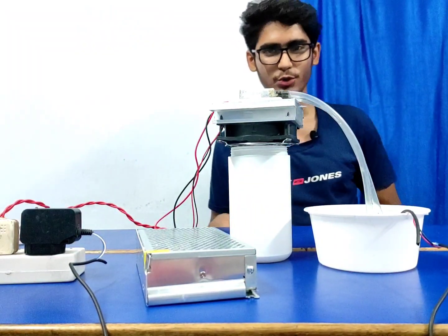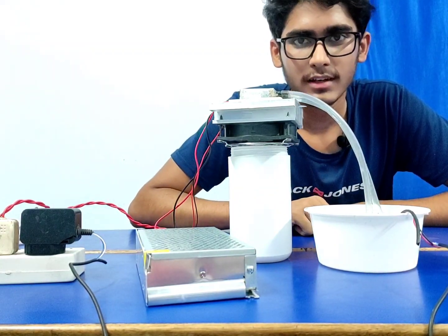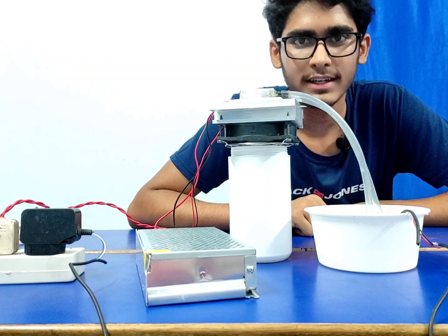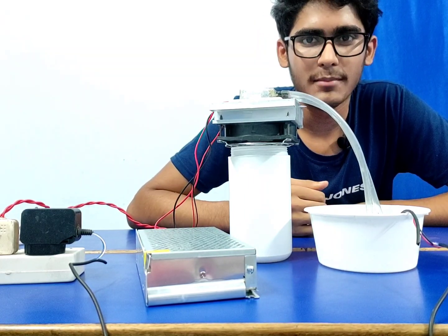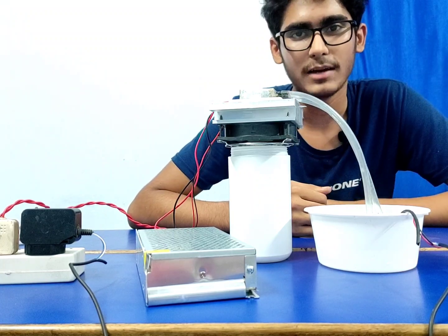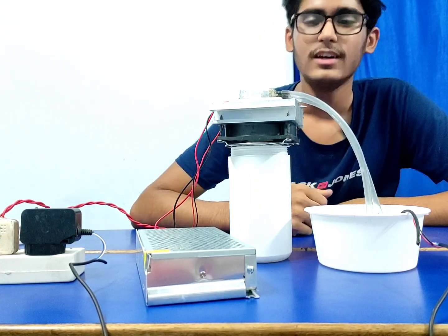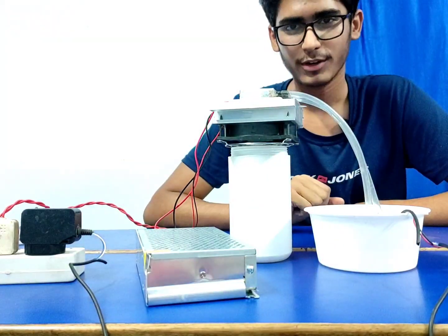I'm going to show you my prototype project about cooling liquids. It can be used for cooling ethanol, water, or anything, and it's very functional for the chemistry lab, physics lab, and also mainly the biology lab, because chilled ethanol is used during DNA isolation. So for that I made some things. I will show you one by one.